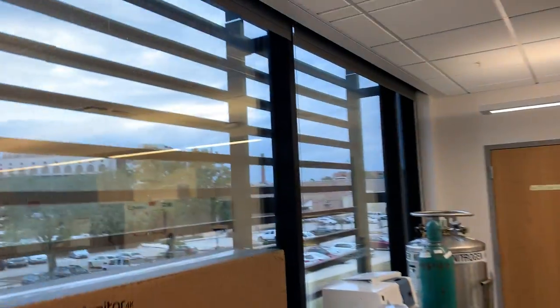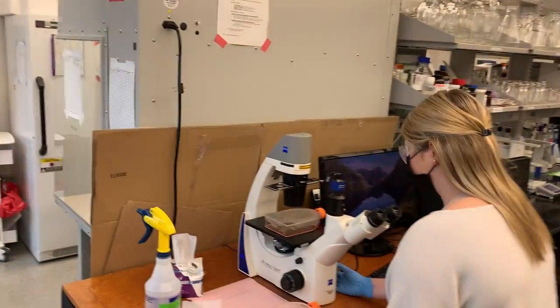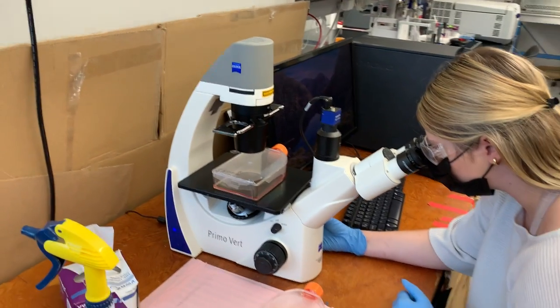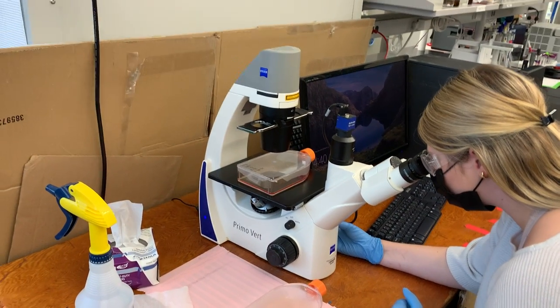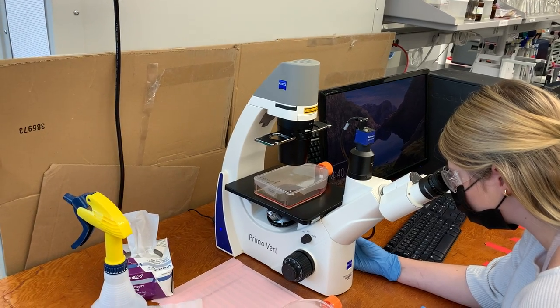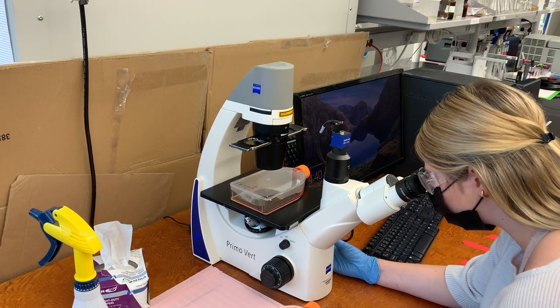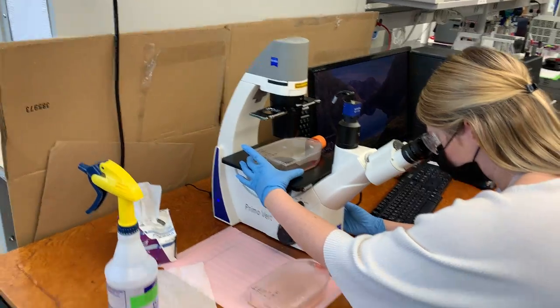We've got a nice beautiful view of Tiger Stadium here. And we come over to Stephanie — what Stephanie is doing is checking her cells. She's growing some MDA-MB-231 triple negative breast cancer cells for a project looking at co-culturing cancer cells and stromal cells.